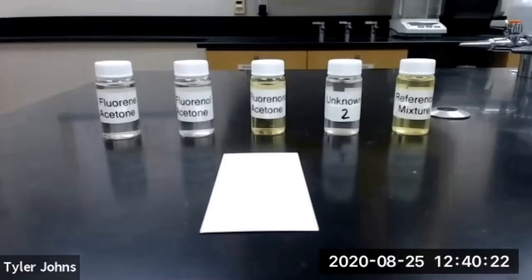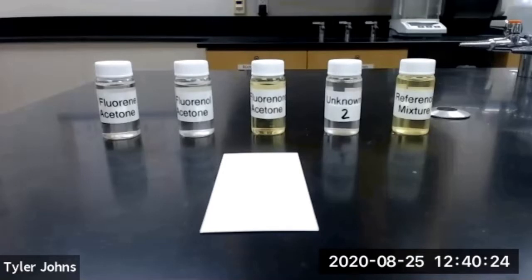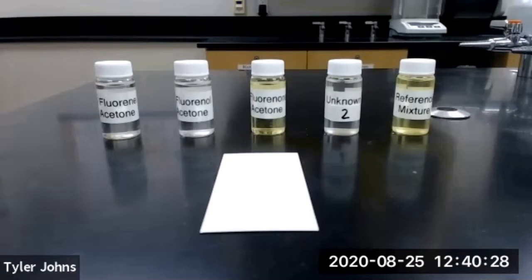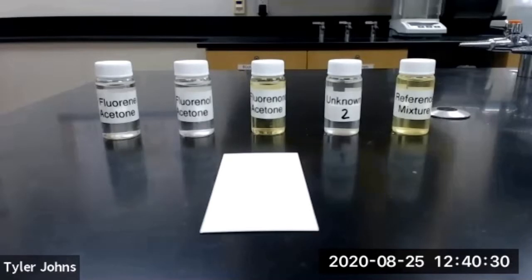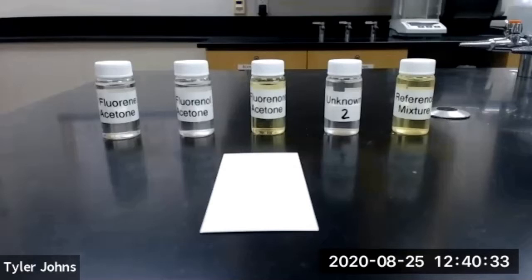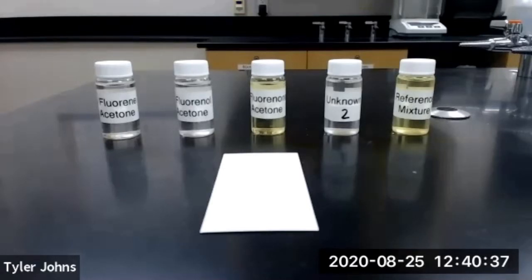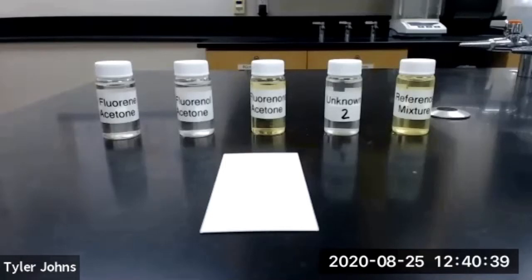In part A of this experiment we're going to use thin layer chromatography, or TLC, to separate a mixture of three compounds: fluorene, fluorenol, and fluorenone. Based on the results of our known samples, we'll be able to determine which compounds are in our unknown sample.